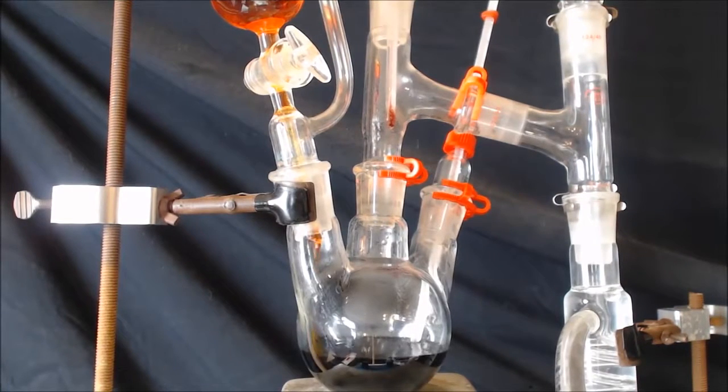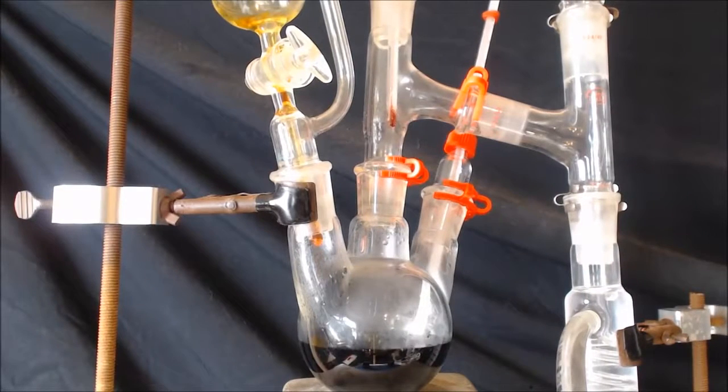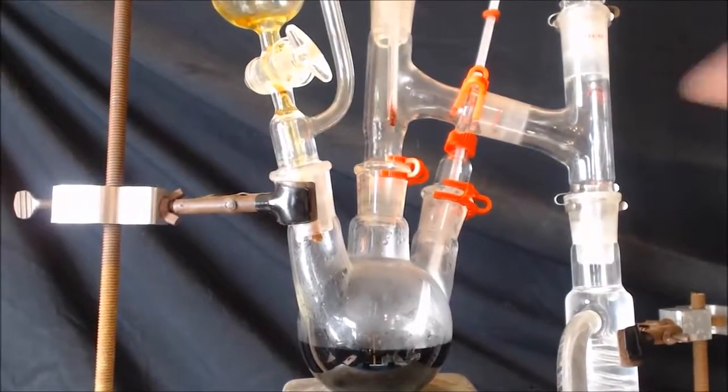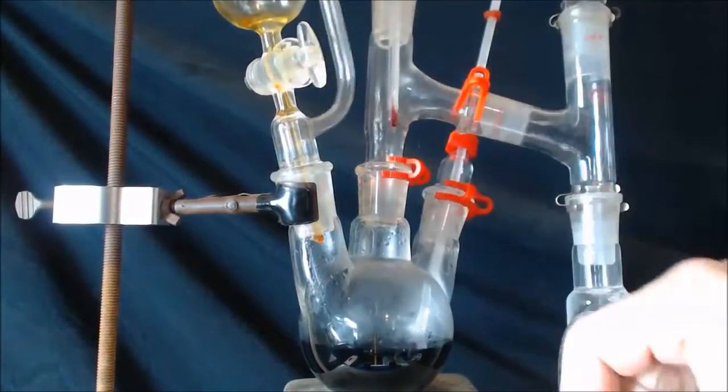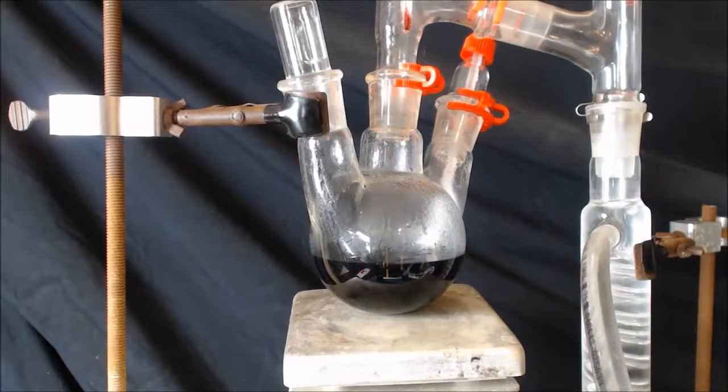Alright, I can't get anything to come off, so I'm just jacking up the heat. I don't know if it's because I'm making so little or what the deal is, but nothing is coming off. Nothing. You can see I got it really coming out now. I could smell it now. Taking off that equalizing funnel. It's starting to come up too now.